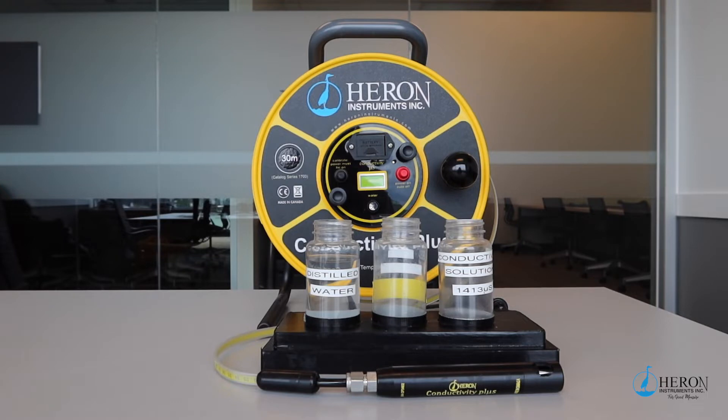The first time the meter is used from the manufacturer, it is already calibrated and ready to go. To obtain an accurate reading that you have confidence in, the following procedure is necessary. Please note, if this procedure is done once for multiple readings in the same day, that should be fine unless you have accessed some dirty or salty water. In that case, you should clean and recalibrate it.